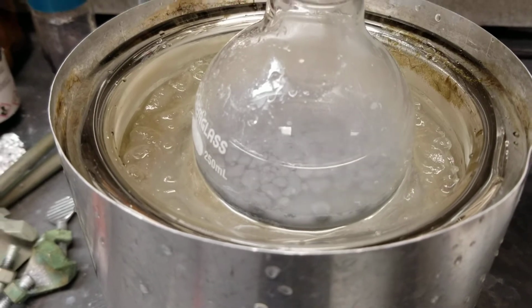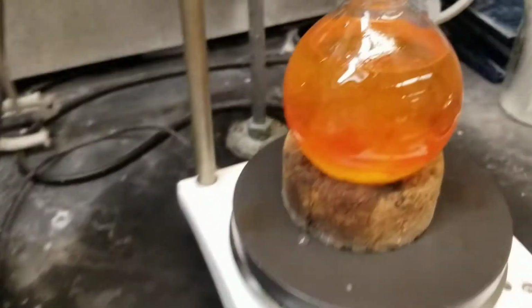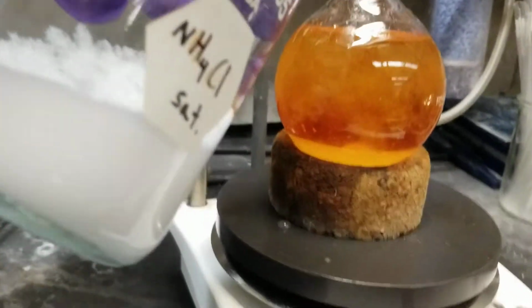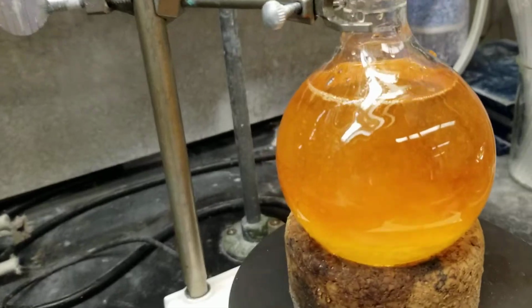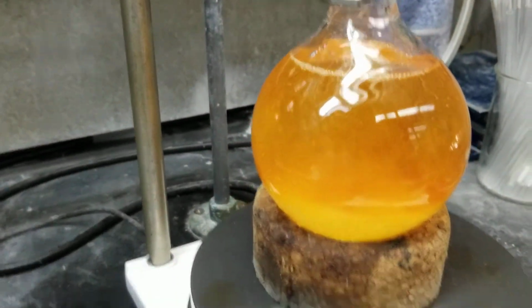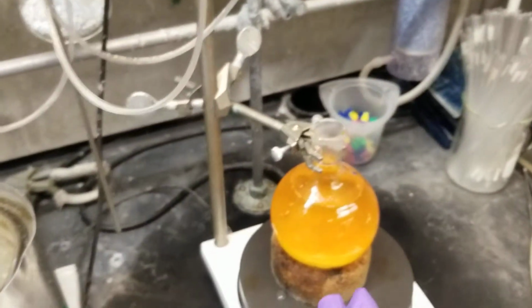You can see I'm forming aggregates and those are producing bubbles. This one, on the other hand, even though they're both stirring, is relatively tame. It looked like there was some change happening in there, but overall pretty tame. And what's going on in these two? So this process we'll call reaction one. This process we'll call reaction two, and I have the schemes drawn up here.